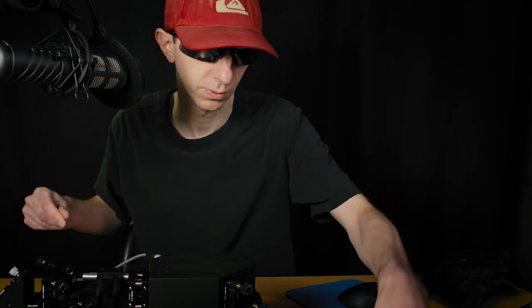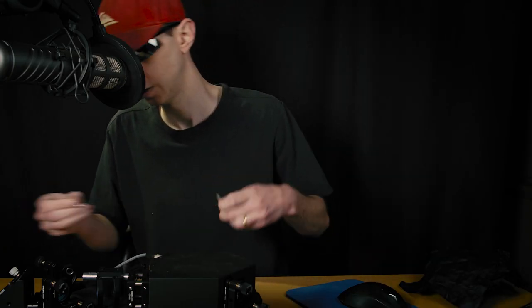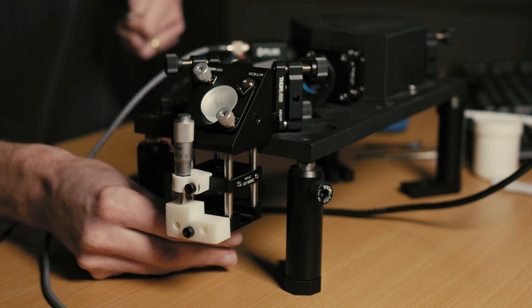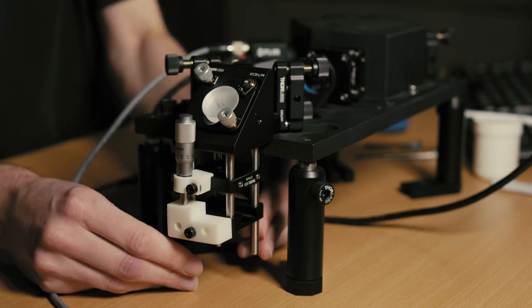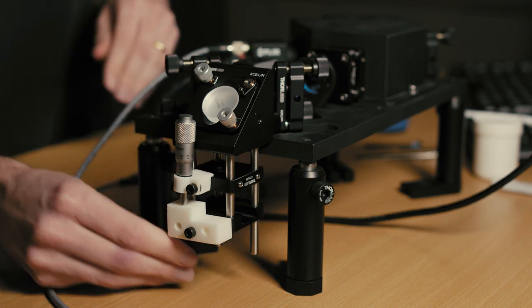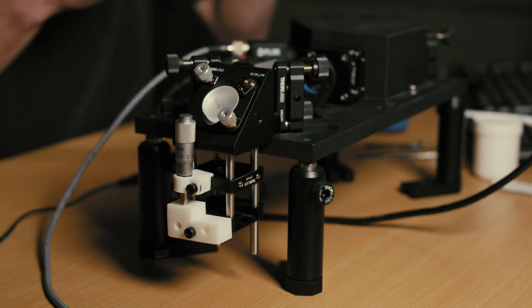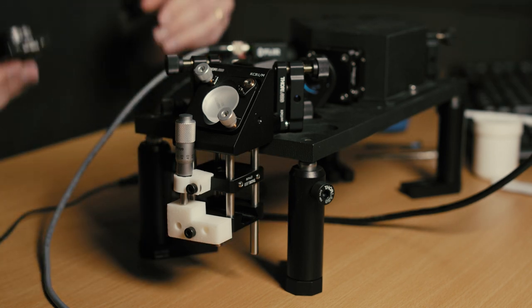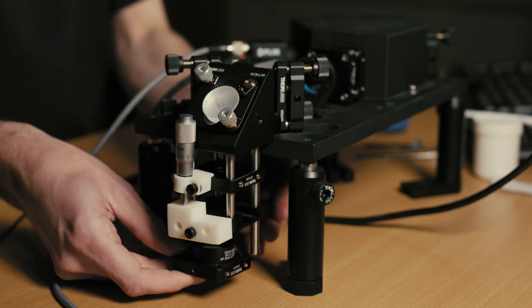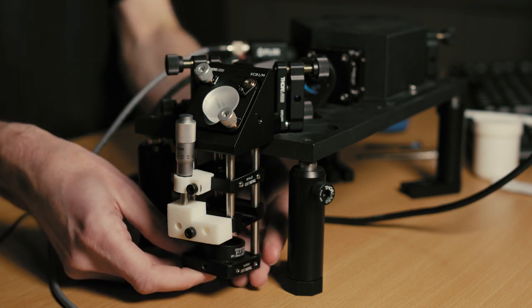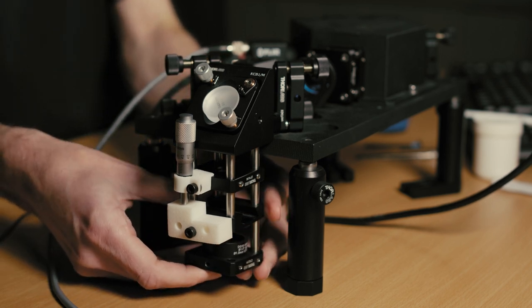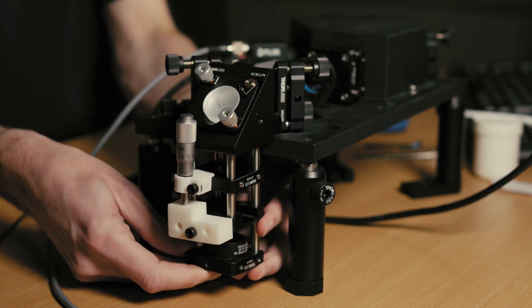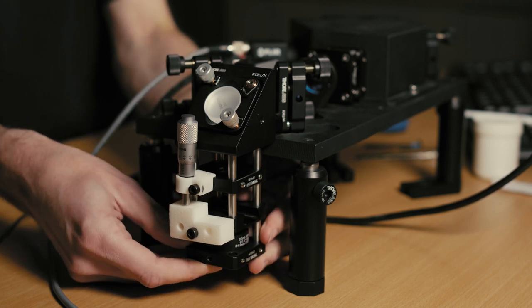I will also insert two extra posts and I will place this diffuser with an aperture at the middle.